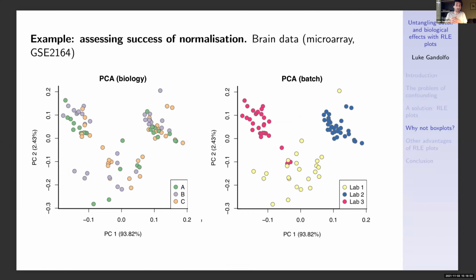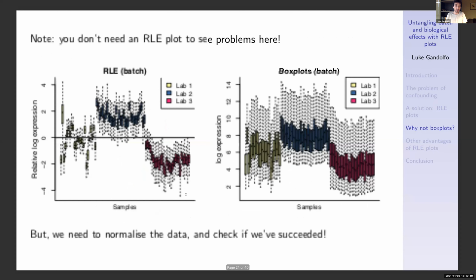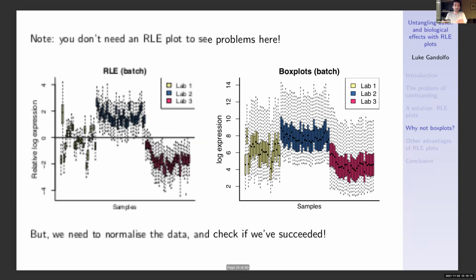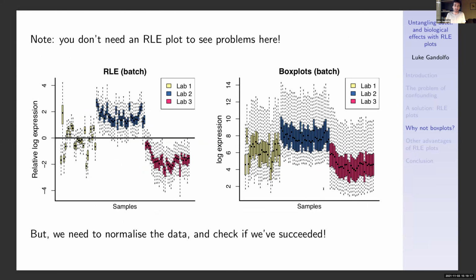What about an example where we're trying to assess the success of a normalization? And for this, let's take a particularly bad data set where we've got significant batch effect for 3 different labs, although I might point out that the biology is reasonably well distributed here. And so this is a particularly bad data set. And indeed, you don't need an RLE plot to see problems here. The box plots show the batch effect just fine. So we definitely need to normalize the data here.